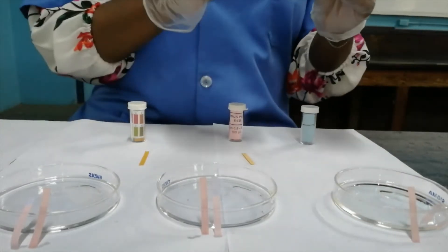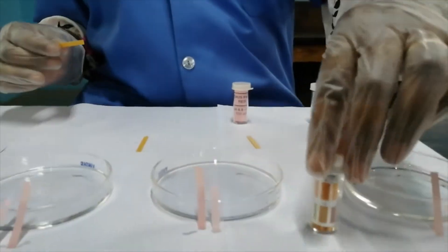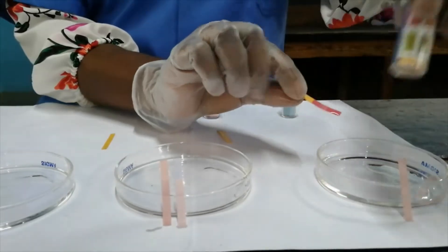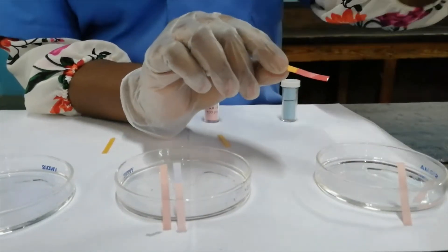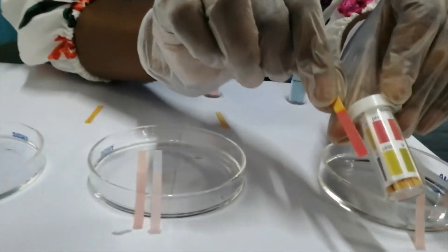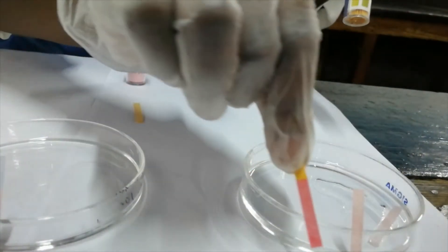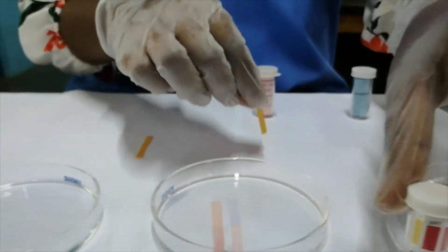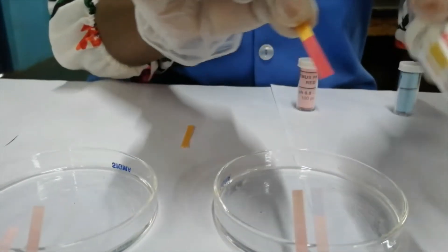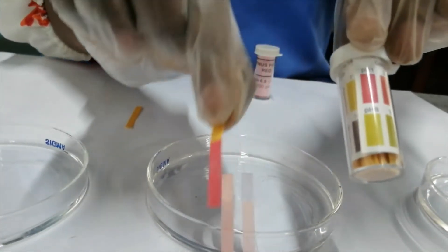Let's look at the effect of acid on pH paper. I'll bring this closer so you can match it to the scale. In this acid — the dilute hydrochloric acid — it changes to this color, so match it to the scale and decide the pH reading. And over here you have the sulfuric acid — what pH are you seeing? You decide.